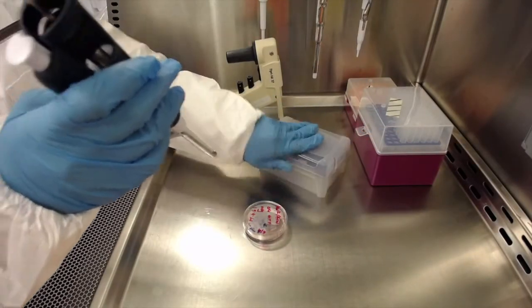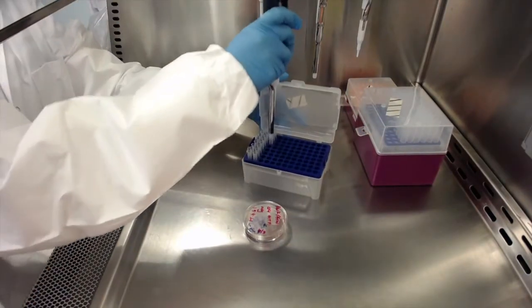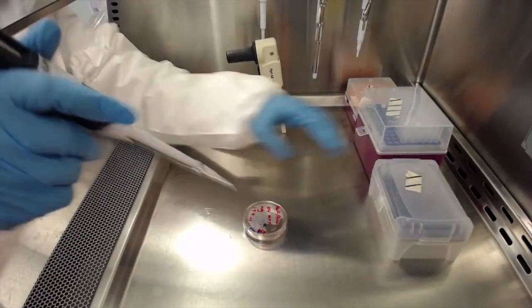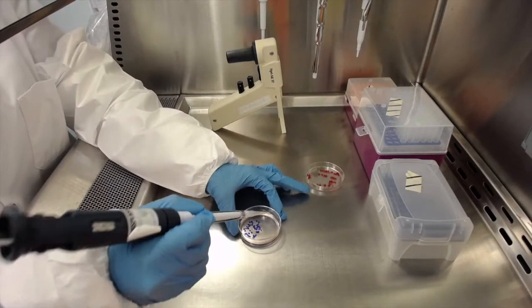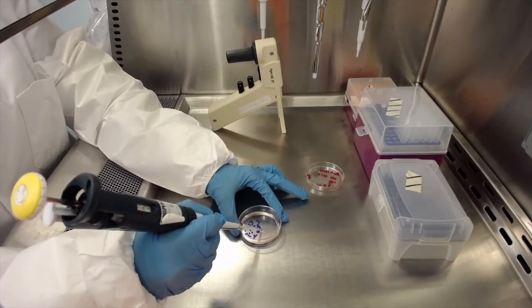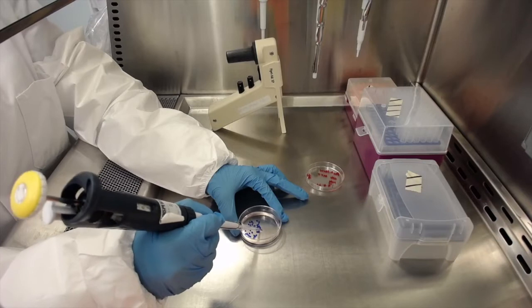To remove the previously marked regions, use a 200 microliter sterile pipette tip inserted into a pipette or attached to a vacuum aspirator. A sterile cell scraper can also be used. In this protocol, we will use the pipette method.